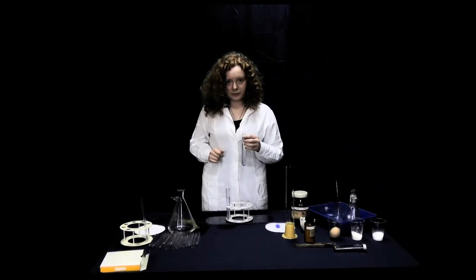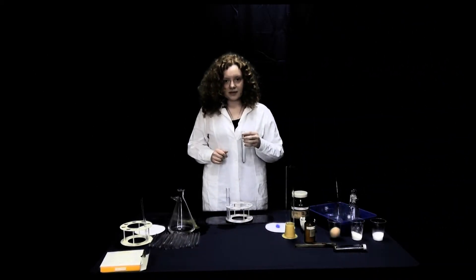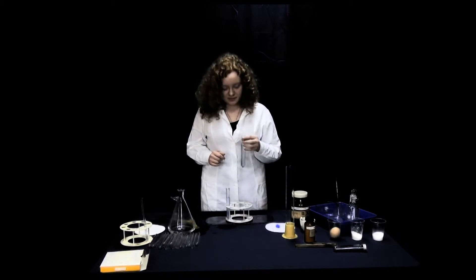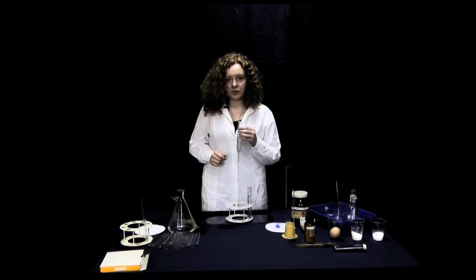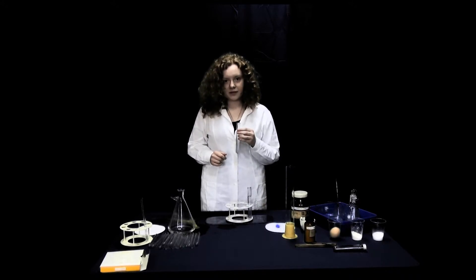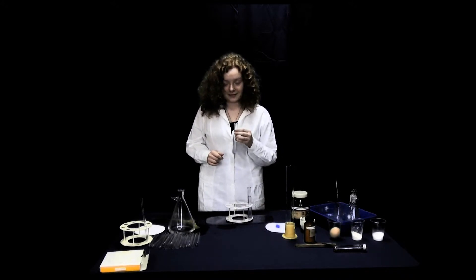There is cold water in the tube. At the bottom there is a crystal of copper sulphate. There is hot water in the tube. At the bottom there is a crystal of copper sulphate.